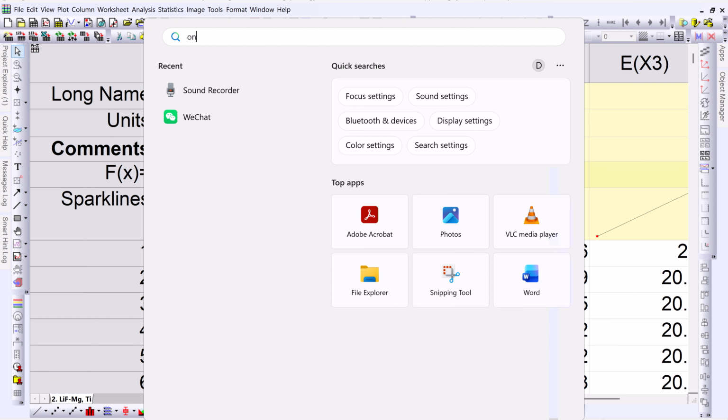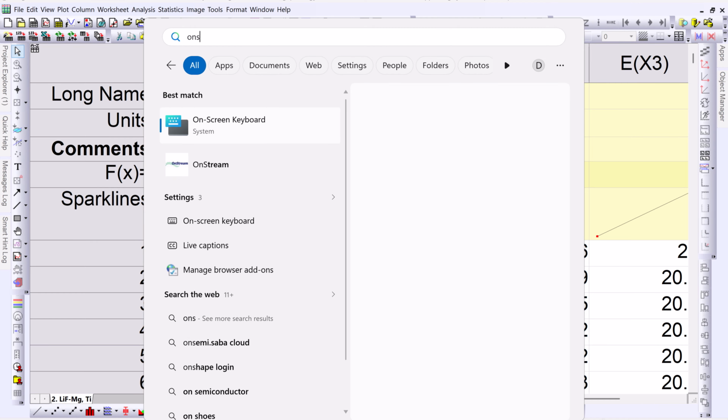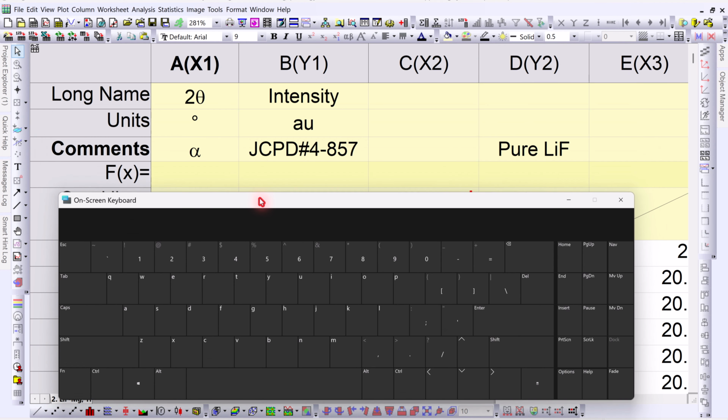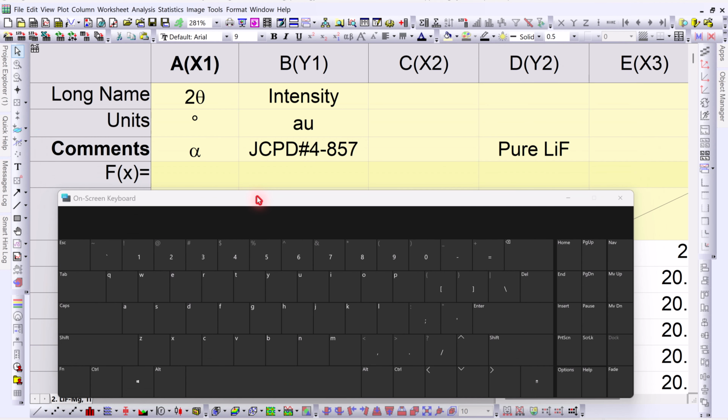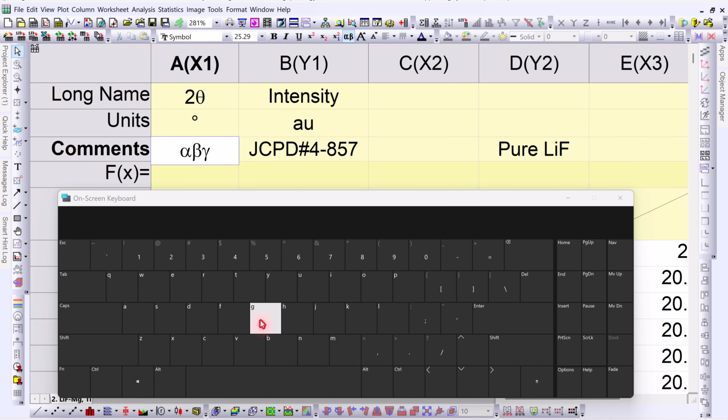Always use /G commands with rich text formatting. This will ensure that your symbols remain stable even after reopening the project, system restart or cache clearing. This is the proper way to fix and avoid this issue permanently.